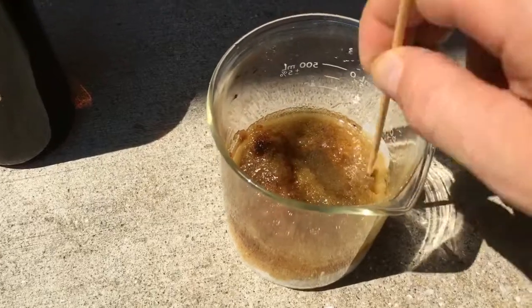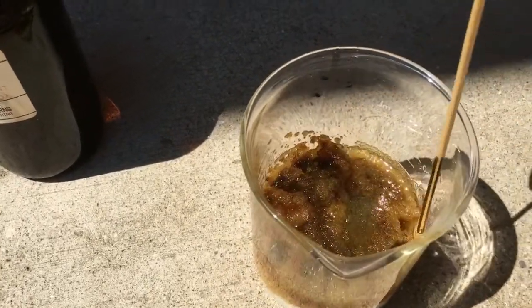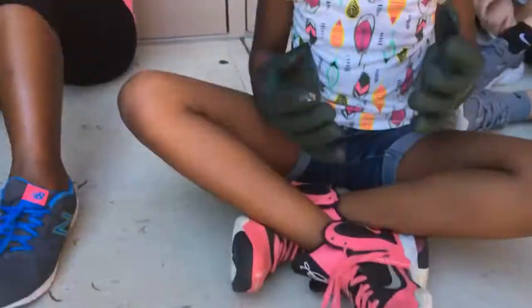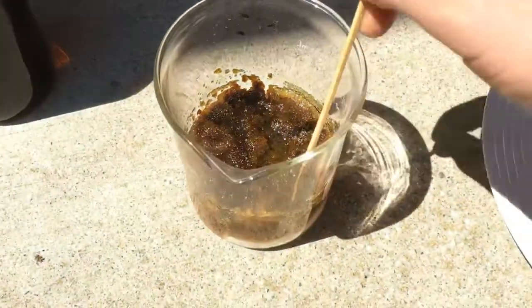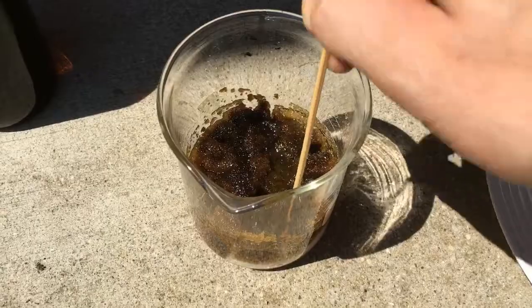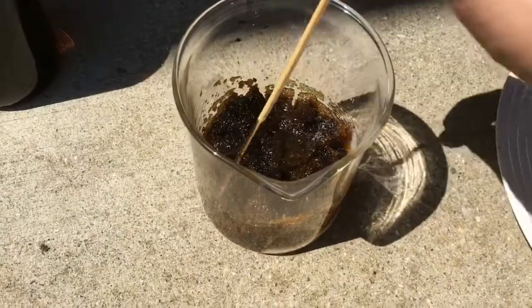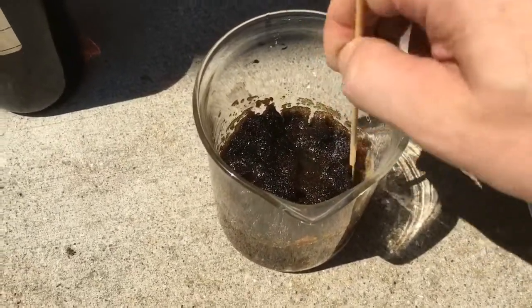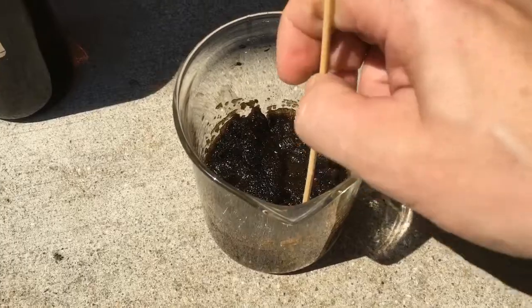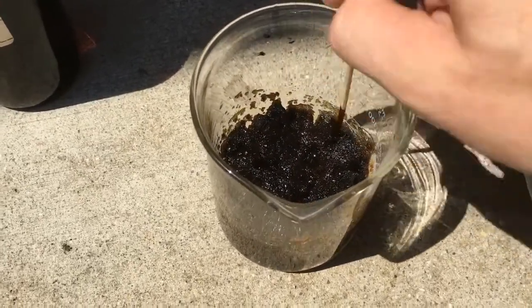You're going to notice that the sugar is going to start changing color. We know that sugar is made of what three elements, Jada? Oxygen, hydrogen, and carbon. And we're mostly carbon-based life forms, aren't we? Look at what pure carbon looks like. It's black, isn't it? Now, what you're going to see here is an exothermic reaction where the carbon is going to break away from the hydrogen and the oxygen, and it's going to move.